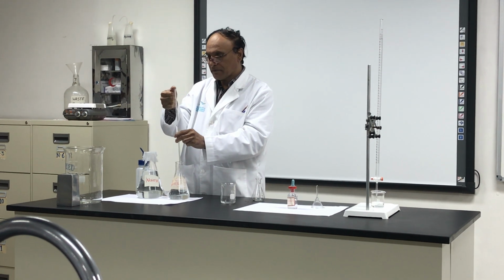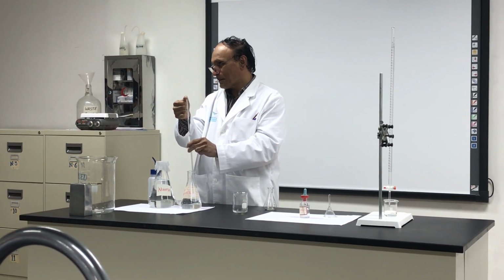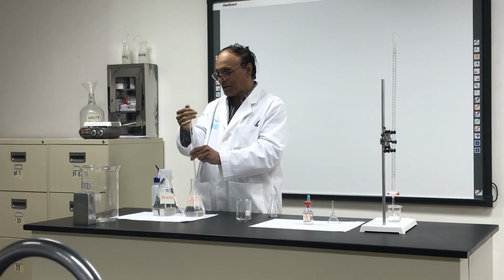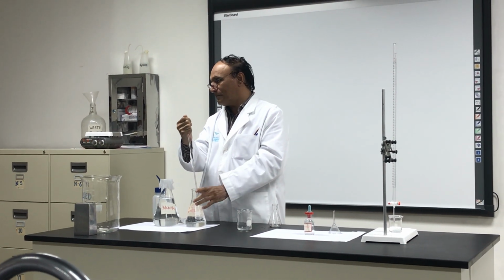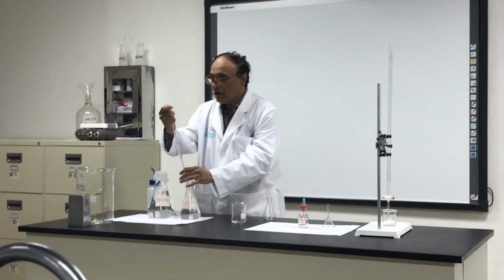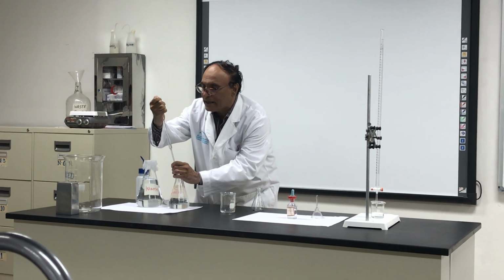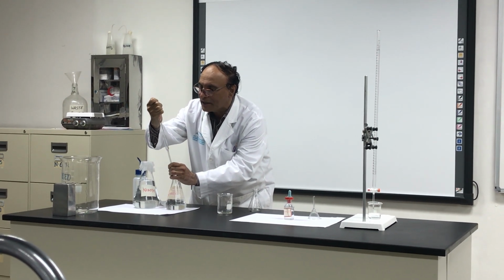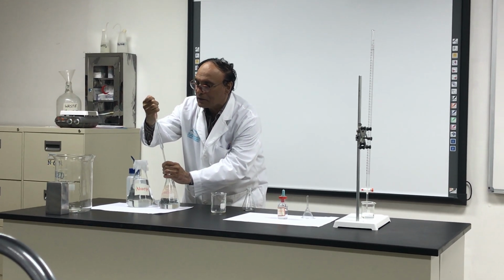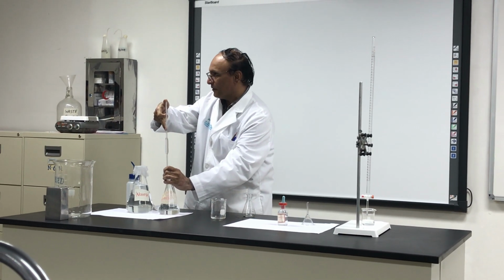Look, I hold it above the mark, right? If you drink it, no problem. It will go to your mouth because this is the vinegar, pure vinegar. Okay? And now you release your air from the finger. You release your air to move it down slowly. Okay? Look, it is below the mark. Do you see? It is below.